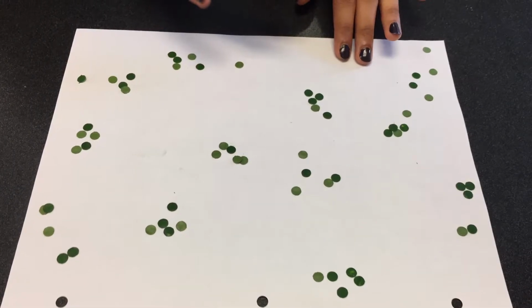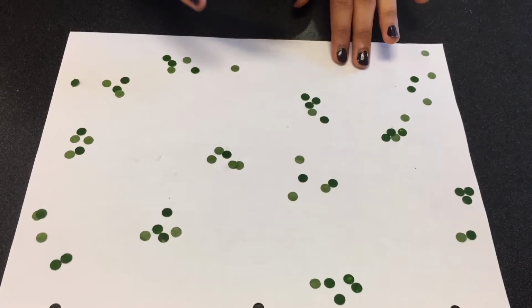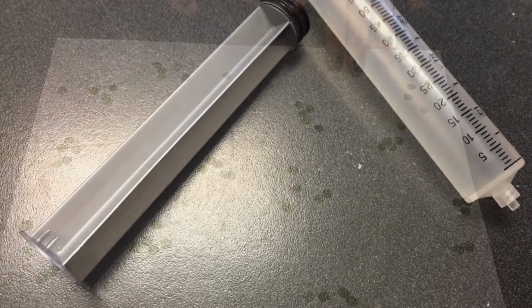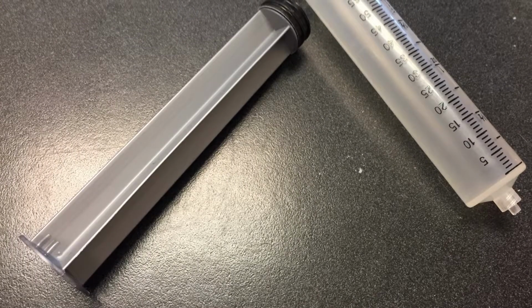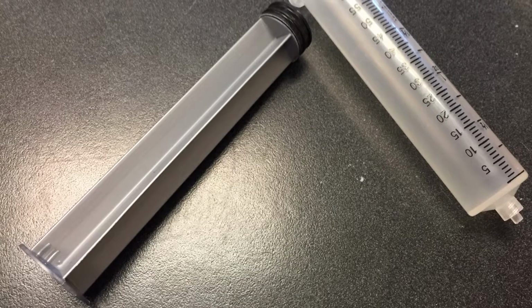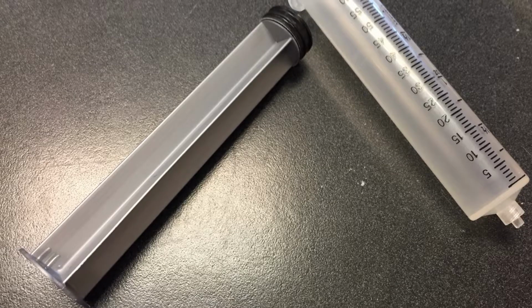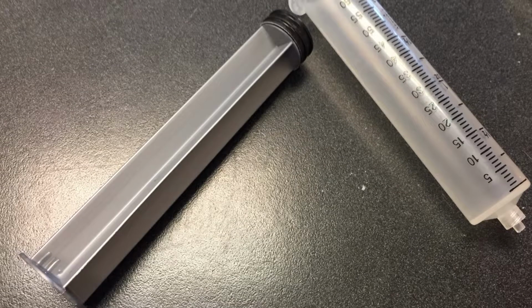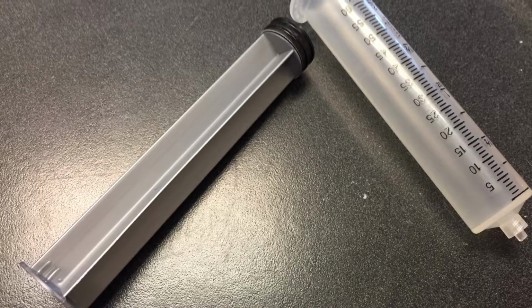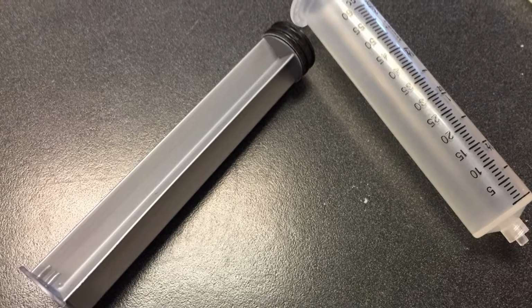Using the hole punch, cut 10 uniform leaf discs for each of the 6 trials. Try avoiding any major veins of the leaf. The next step is to suspend the leaf disc in the 0.2% solution. This is a very important step because the leaf disc has oxygen in it, so it will float. So to make them sink, we will be removing the oxygen and pushing in the sodium bicarbonate solution so that there's also a source of CO2 for photosynthesis to occur.